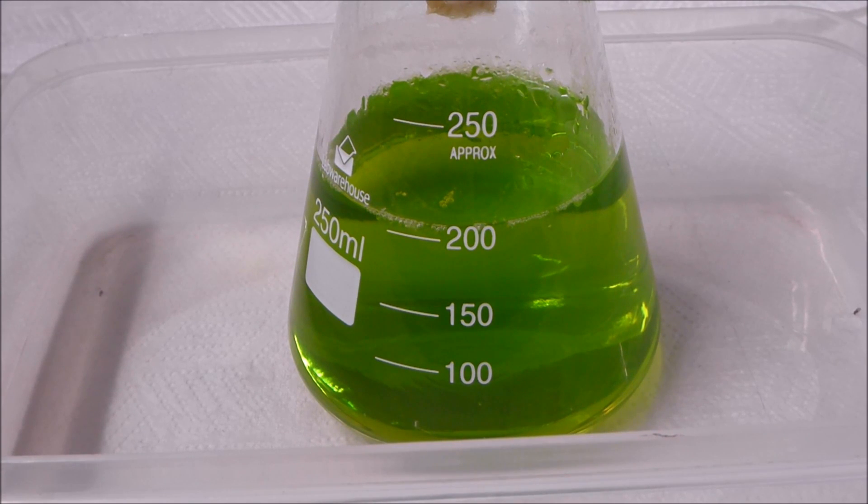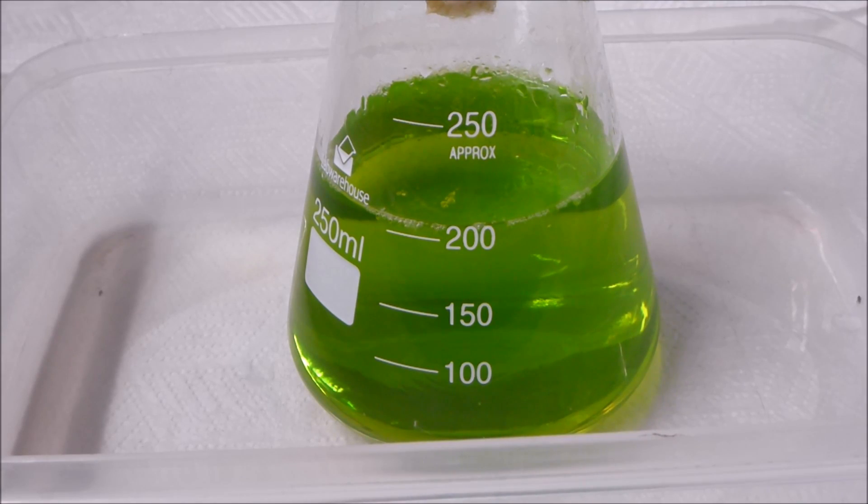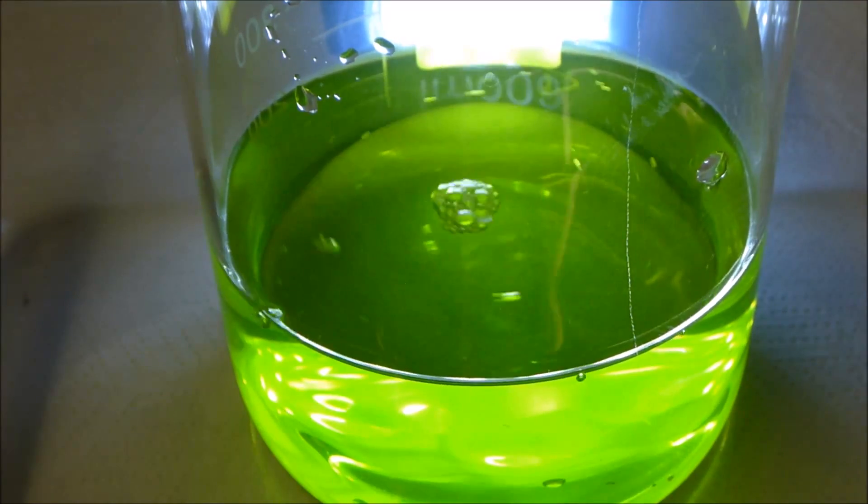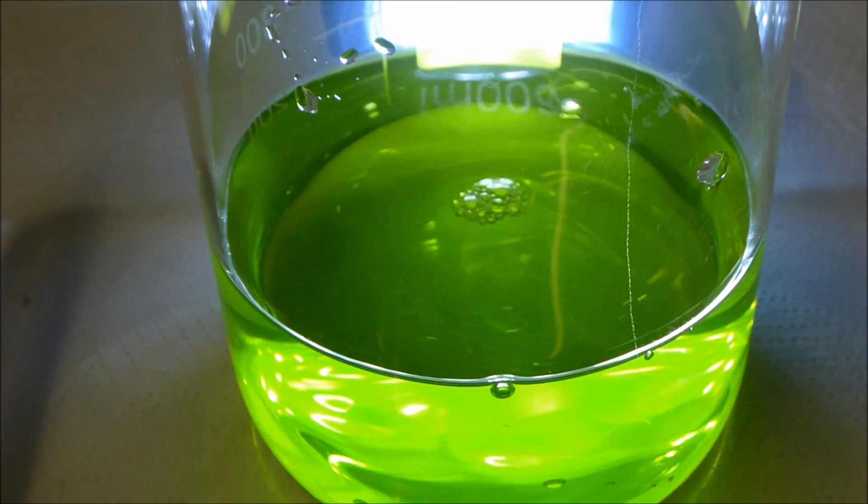What we'll quickly do now is, I know that we're probably looking at about three to four grams of gold in there, so I will measure out eight grams of sodium metabisulfite and we'll just add that in the dry form and see if we can see a nice reaction to round off this night. I'll just get this over to a beaker and we'll give that a go.